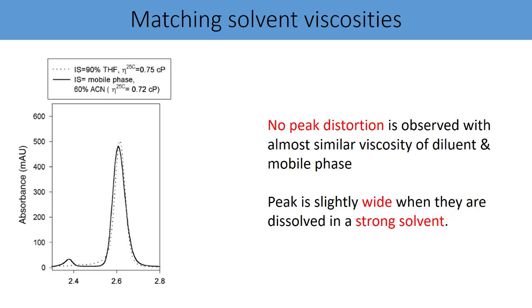And look at the peak. You got a very beautiful peak just by using this diluent as a mobile phase, which is quite acceptable or expected. But look at the dotted line chromatogram over here with the 90% THF, but having the similar viscosity of 0.75 cp, which is very close to your mobile phase viscosity, which is 0.72 cp in this case. And you will find a beautiful peak shape for this kind of diluent having almost similar viscosities. So what is the learning? No peak distortion is observed with almost similar viscosity of diluent and the mobile phase.